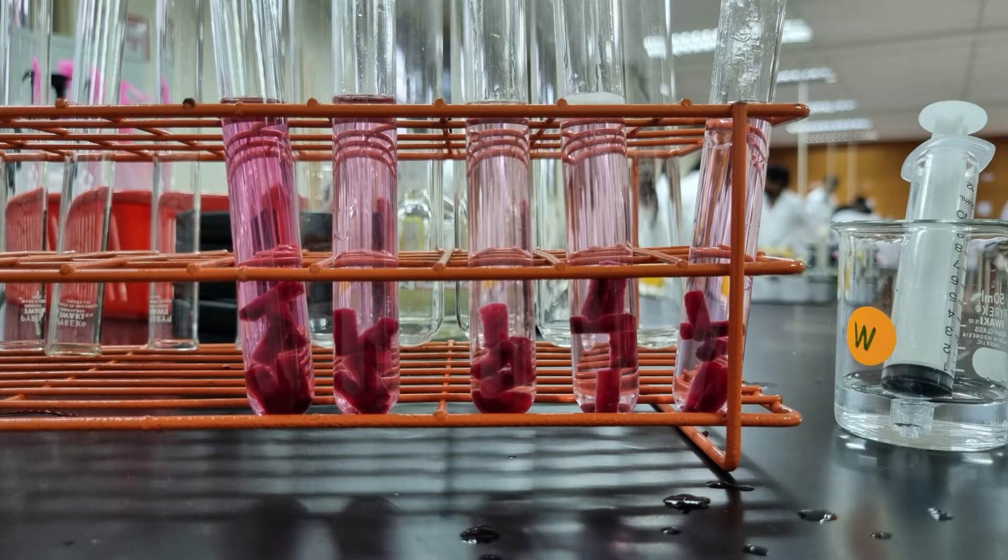Anyways, we can see our results here. It looks pretty good. The highest concentration of ethanol would have the most intense color. And this is because ethanol will make the membrane more permeable.